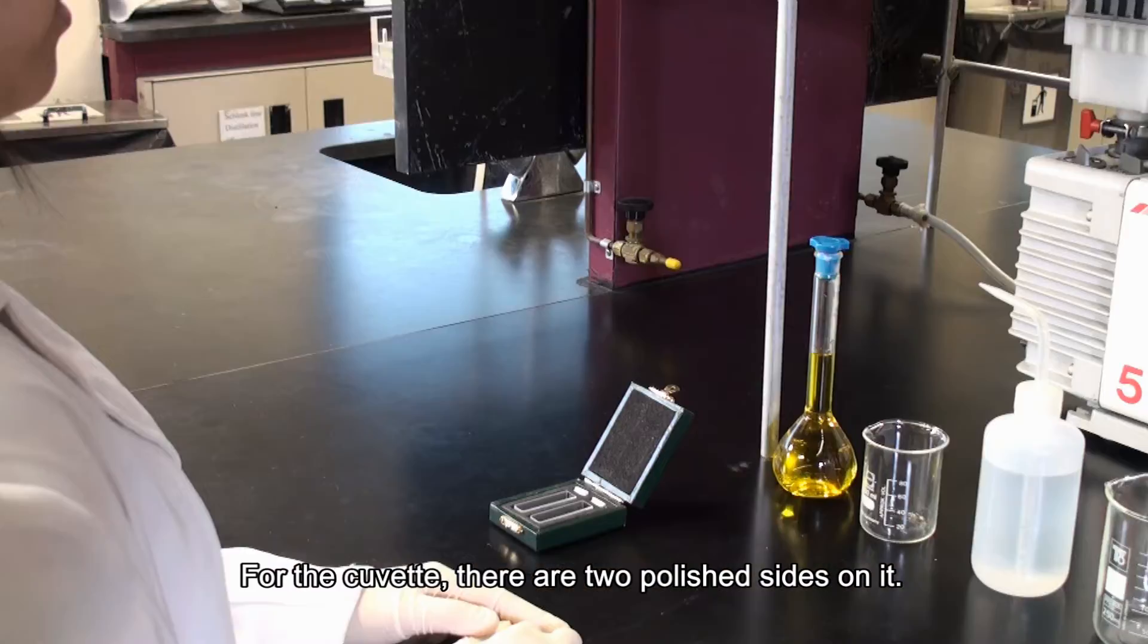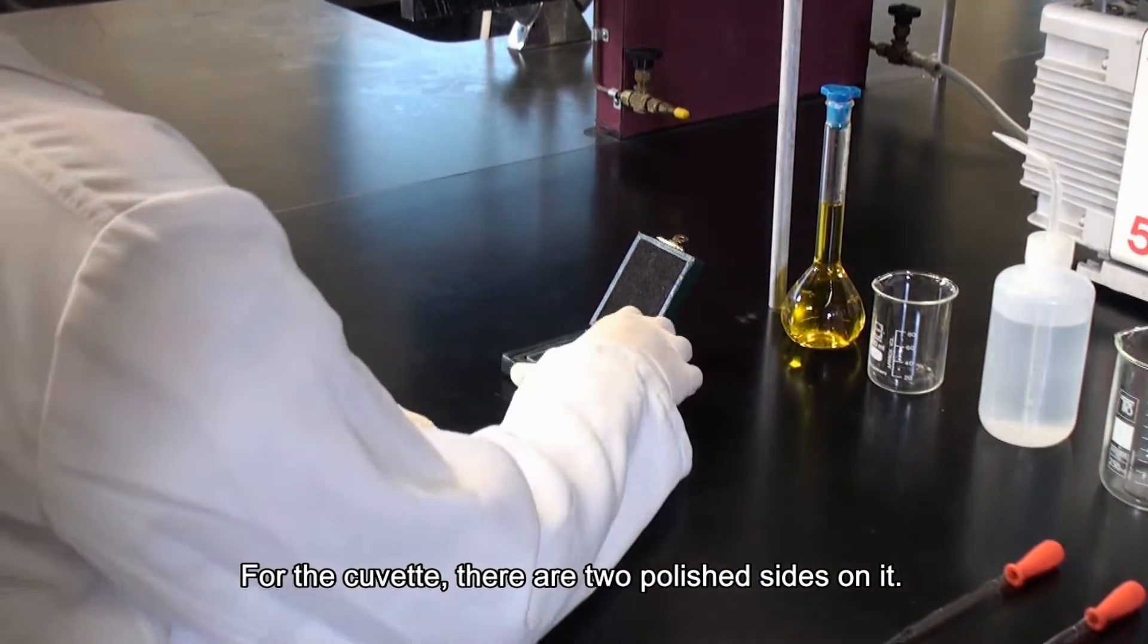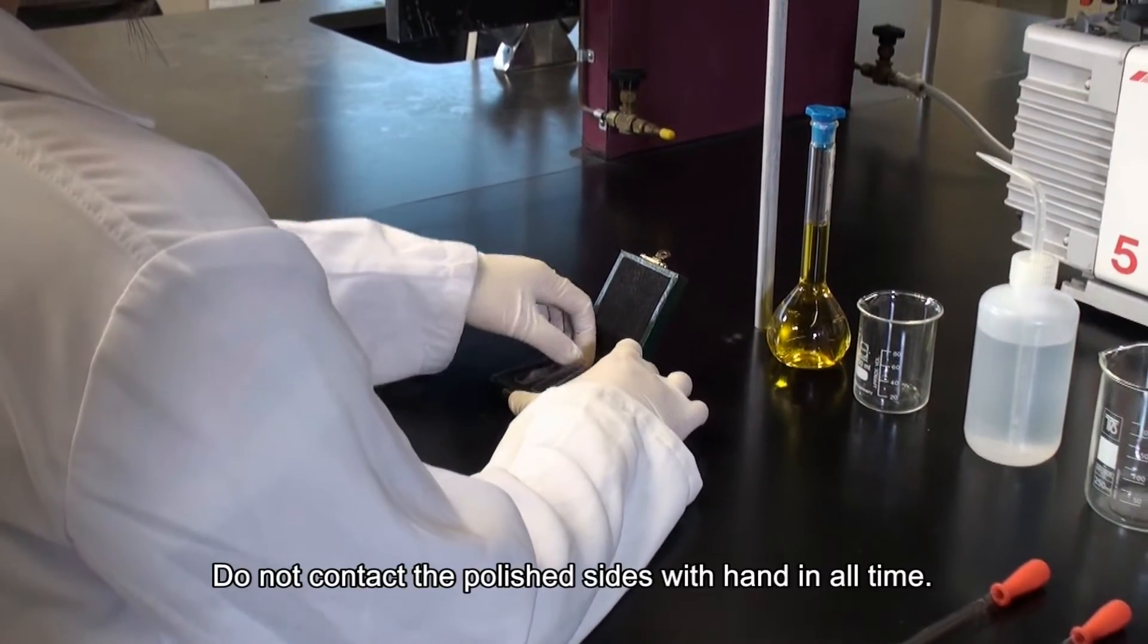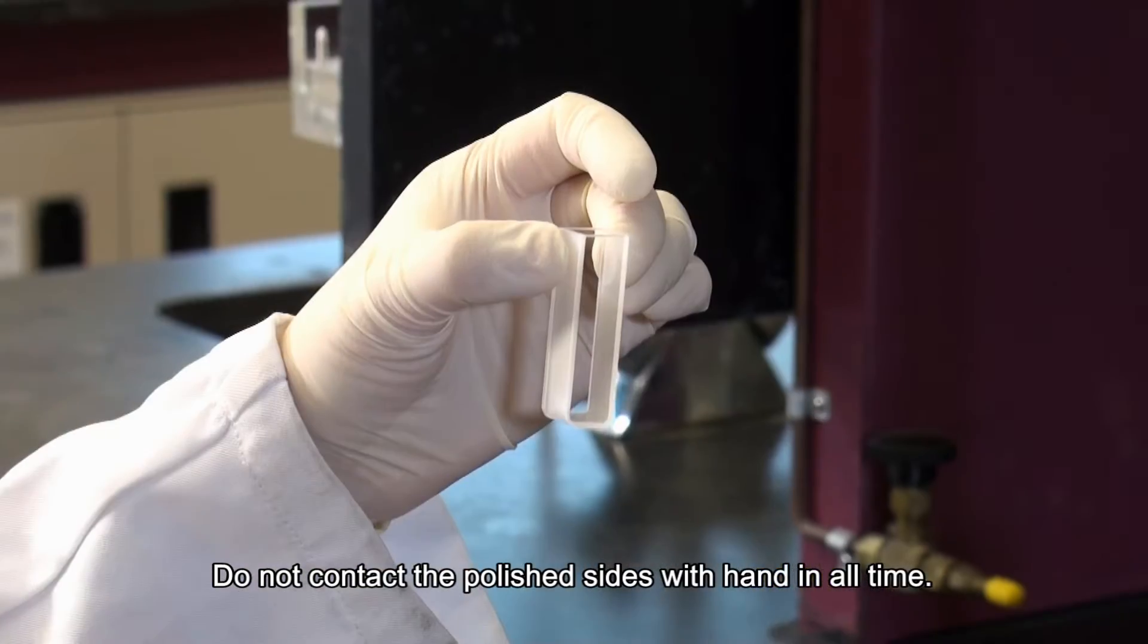For the cuvette, there are two polished sides on it. Do not contact the polished sides with hand at all times.